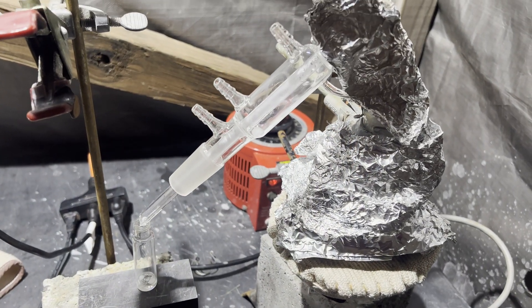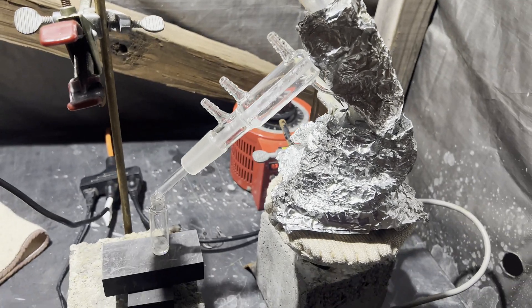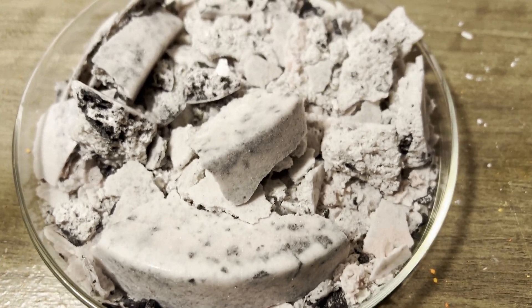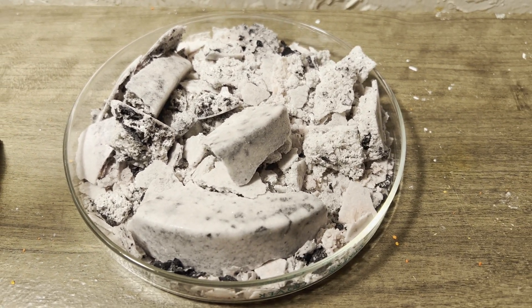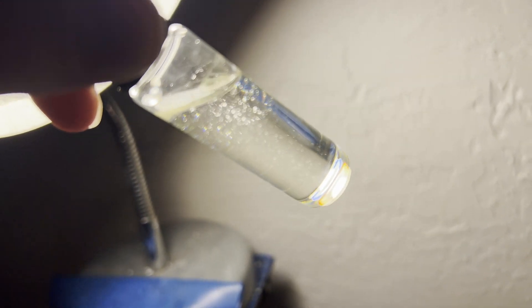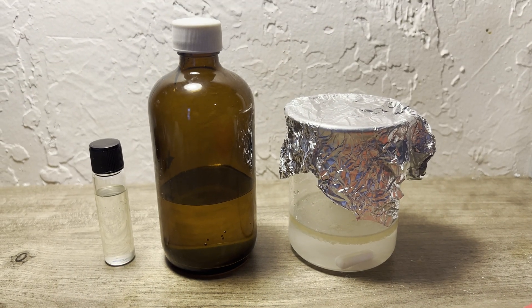I dehydrated the sodium sulfate by heating it and it ended up being 215.9 grams. This is slightly more than the theoretical amount, and you can see all the black material interspersed with what should be the white salt, so there's clearly some oxidized aniline-derived products and probably some absorbed water skewing that number. Here's all the maths. Based on this, my low yield of quinoline in that video makes a lot of sense now.